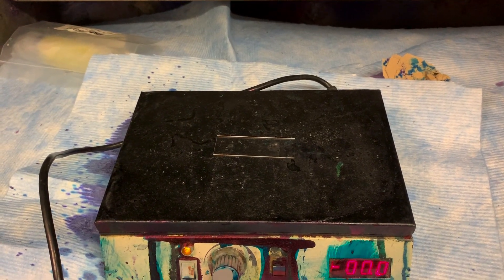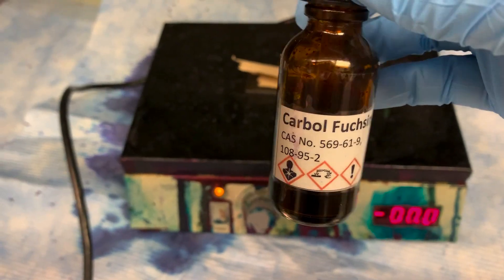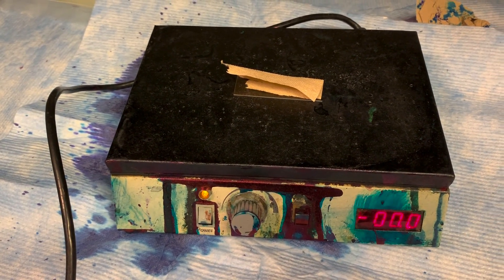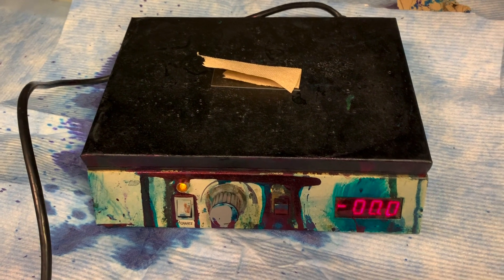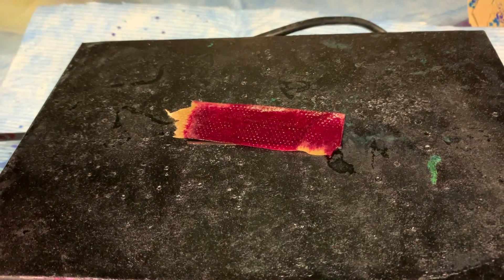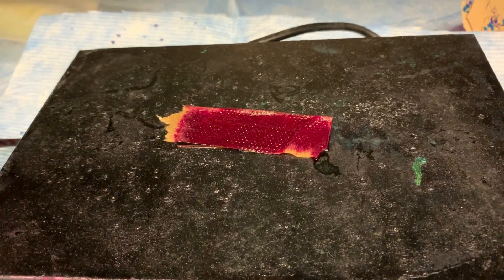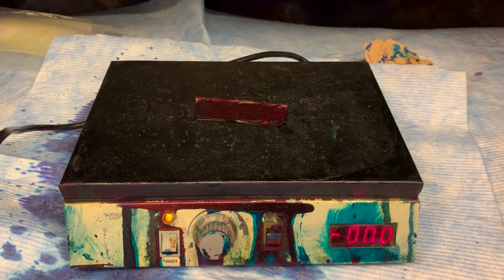The next step is to place the slide on a warmer, cover it with a paper towel, and then soak it with a stain called carbolfuchsin. This carbolfuchsin is a pink stain that gets into that waxy layer. I have to watch it and keep it wet for the next three to five minutes. You can see I've soaked the paper towel covering the slide in carbolfuchsin and I'm making sure the stain doesn't dry out. My three to five minutes is up — I did four minutes just to split the difference.